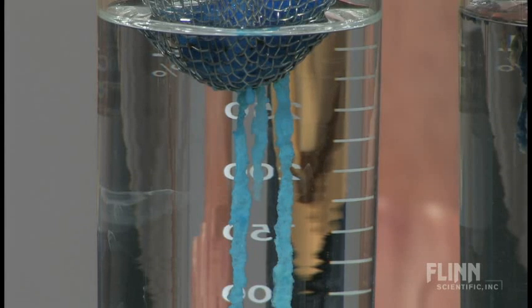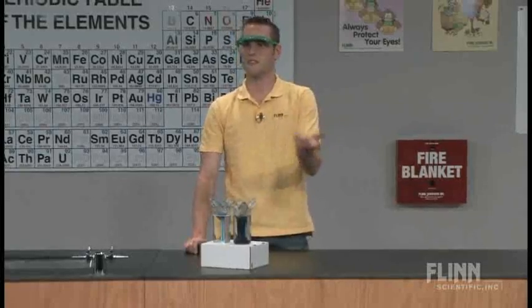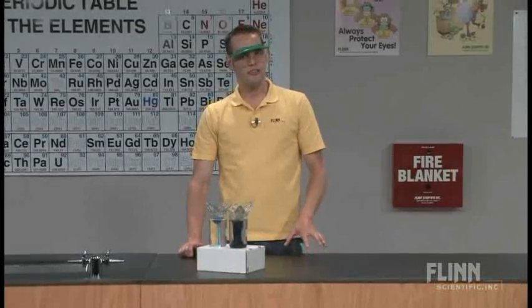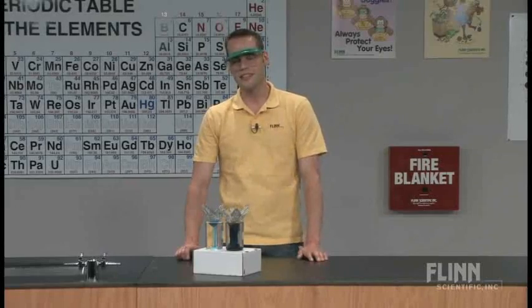Crystal growth happens very slowly and it's hard to create. But when students can actually see crystals forming inside of a solution, it really is a magical thing the first time you ever see it. For us as chemistry teachers, it's sort of old hat — crystals are growing, they're pretty. But that first time a kid really gets to see a crystal form right before their eyes, it is truly a beautiful and magical thing to observe.